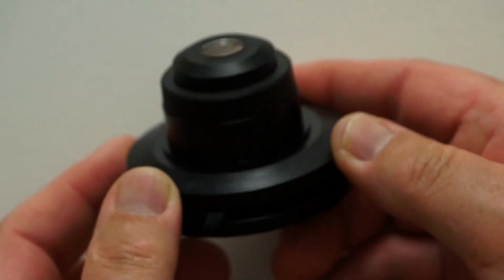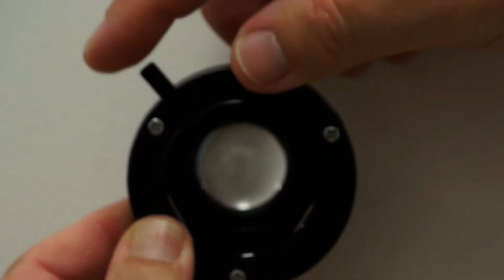Now remember, the important thing about a confocal microscope, and the feature that makes it distinctly different from regular compound microscopes, are the pinholes that are in the microscope. Think of the diaphragm that we use in the condenser to give us contrast and depth of focus on a bright field image. If you're looking at unstained cells through the microscope, in order to achieve contrast and depth of focus, you close down that iris diaphragm in the condenser, and that brings your cells more crisply into view. The same principle is applied with the pinholes in the confocal microscope. And there are two pinholes, one that is adjustable and one that is fixed, that allow us to eliminate extra light that we're not interested in and only give us light in an optical section, so we get the crispest images of a thin optical section of our tissue.